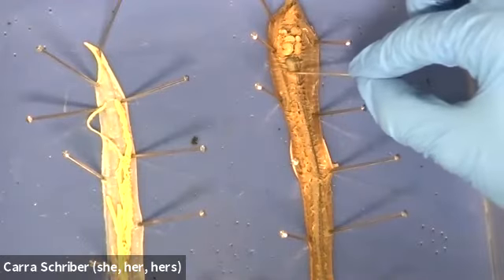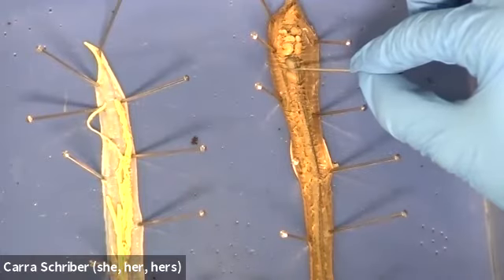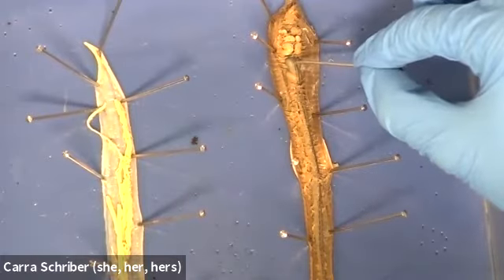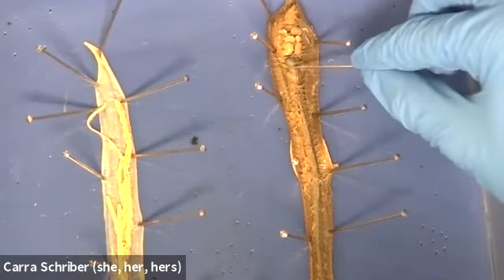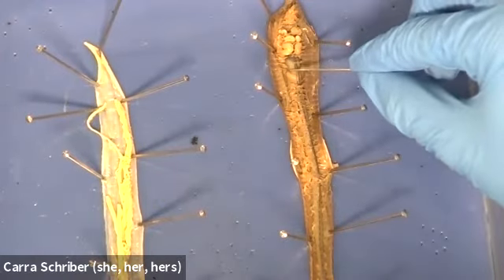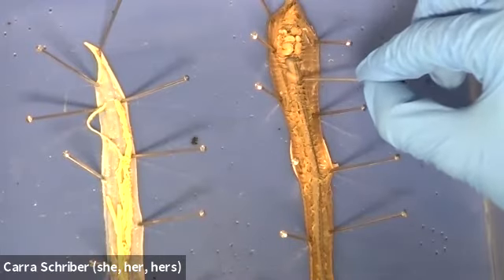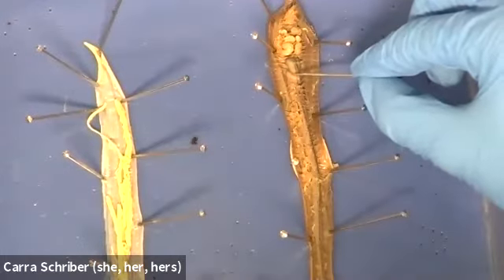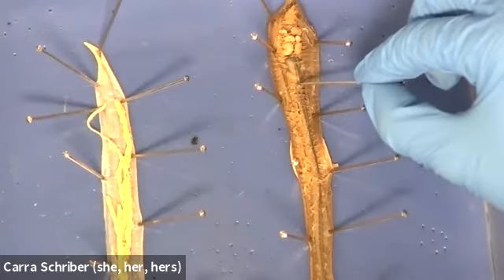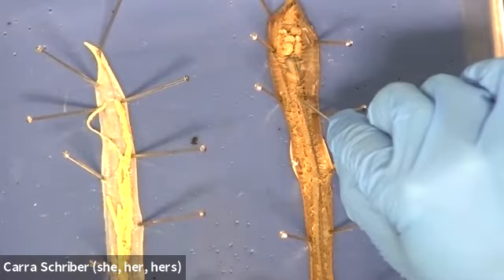So you can see it's kind of darker, and it's from here to here, okay? And that is going to be our crop. So we have mouth, pharynx, and this kind of ball-shaped or globular thing, that's going to be our crop. The next organ directly after that, you can see, is a little bit lighter. So from here to here, that's going to be our gizzard. And then we start here after the gizzard with the intestine.